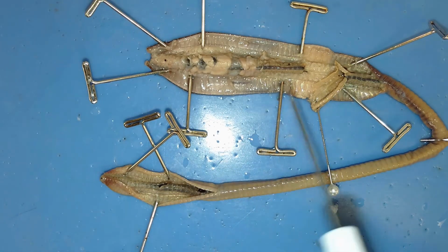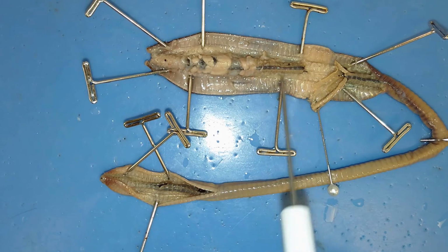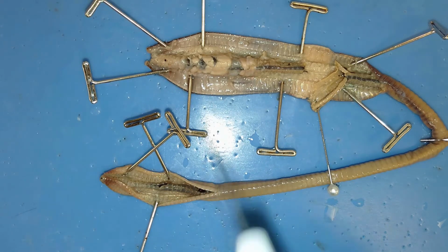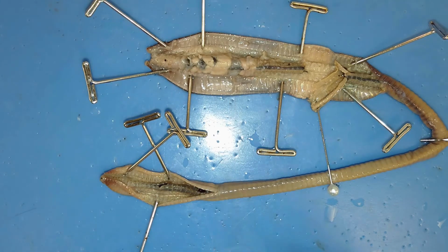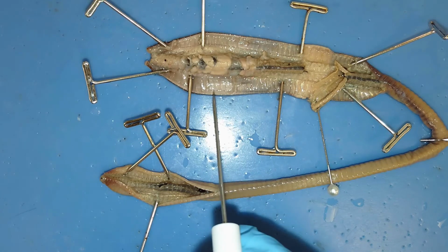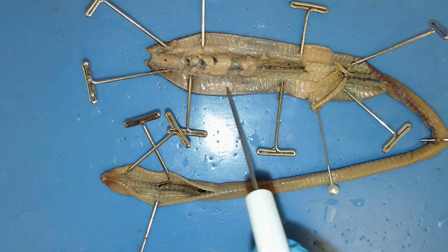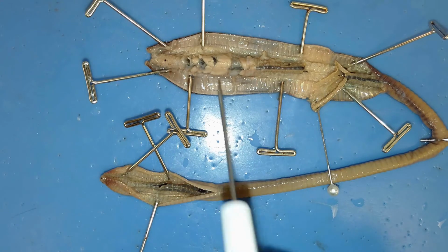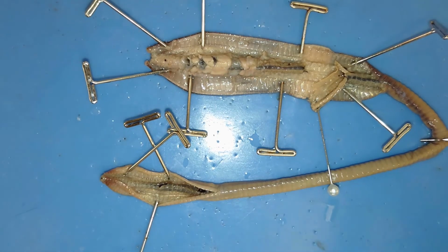So we would consider this organism to have a closed circulatory system. There's no openings, it's all kept inside capillary beds or veins. There's a couple of capillary beds that you can't see close to the nephridia, part of the excretory system, which would be around this area as well. There are several capillary beds which reabsorb nutrients or water or anything else that it doesn't want to waste before that excretory system, those metanephridia, pump out that waste from the body.